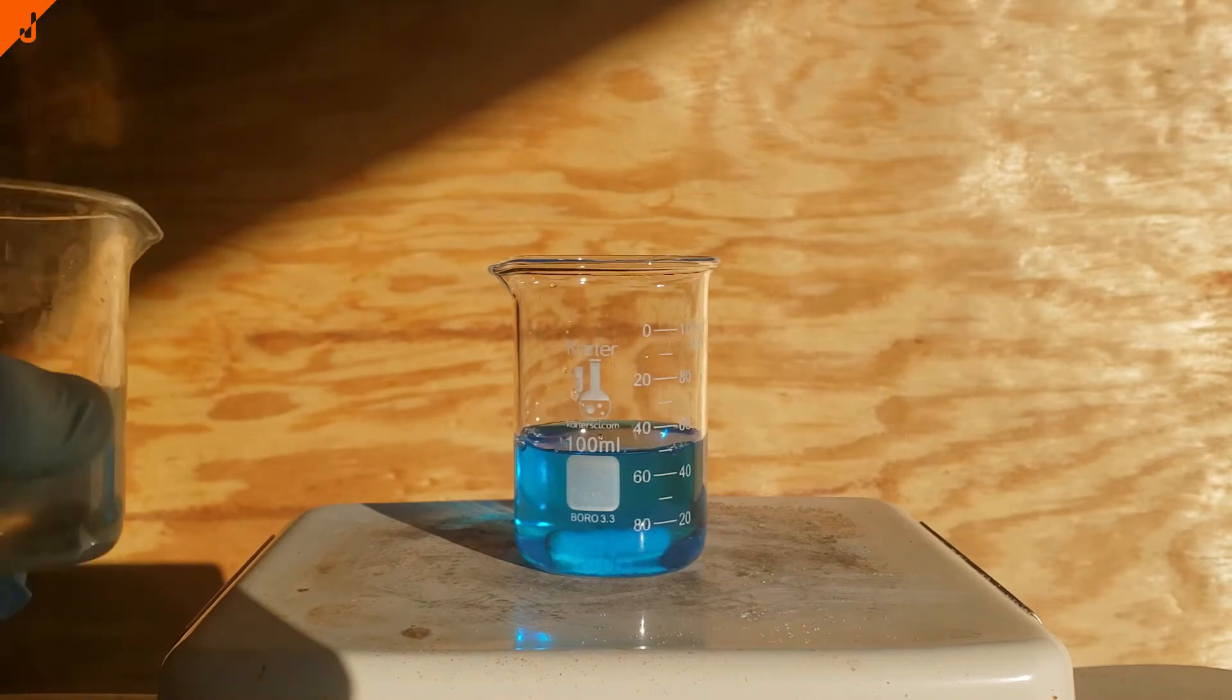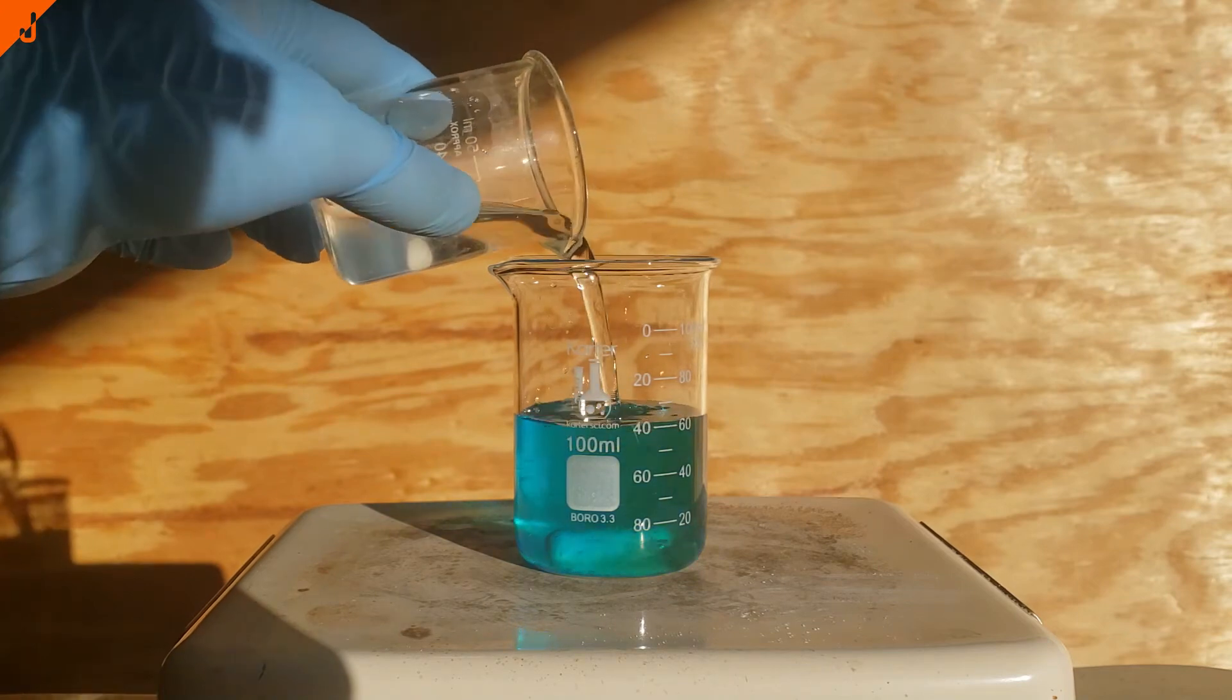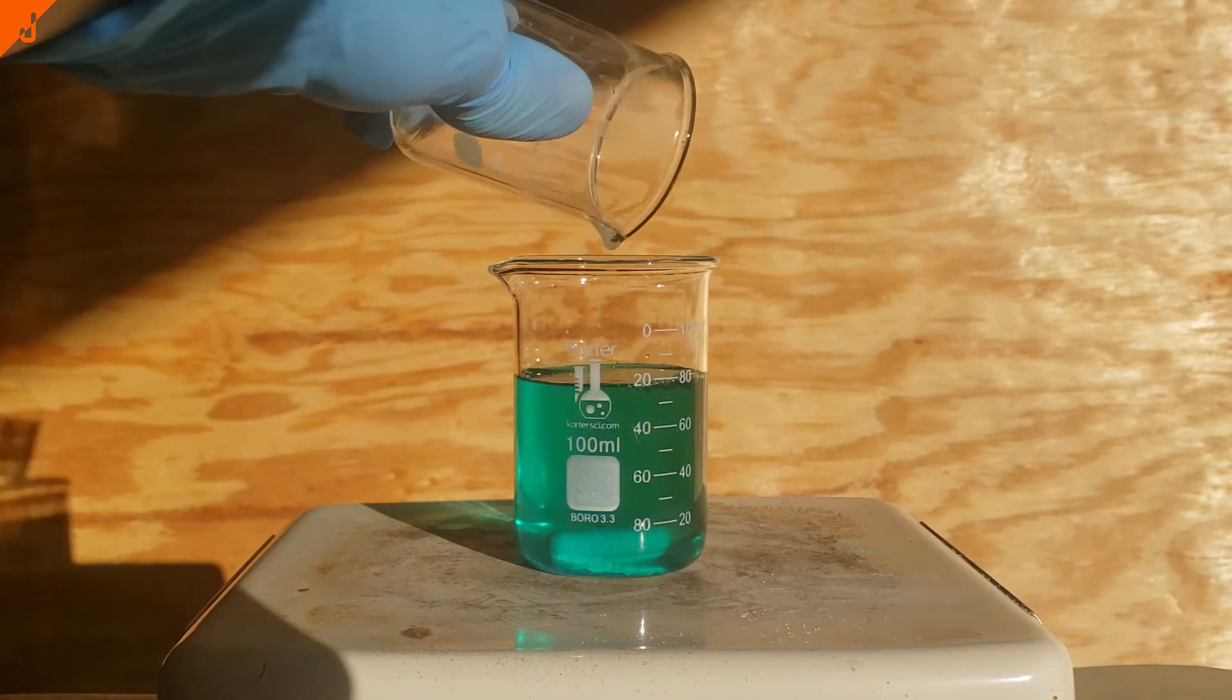The only reason why I added it slowly is because I wanted to see if there would be any big color change right off the bat. However, it seemed to be more gradual.